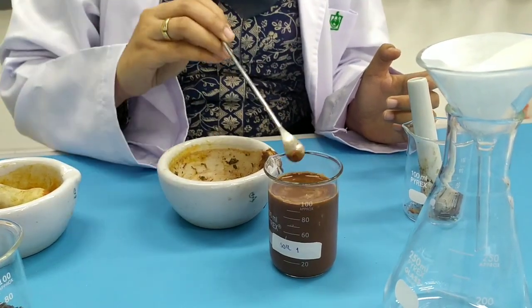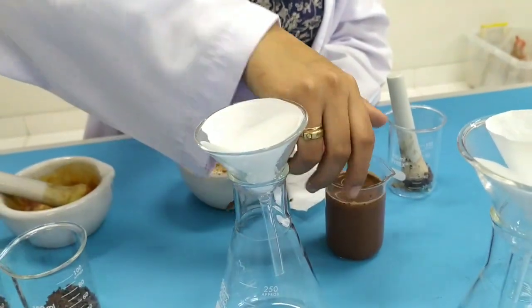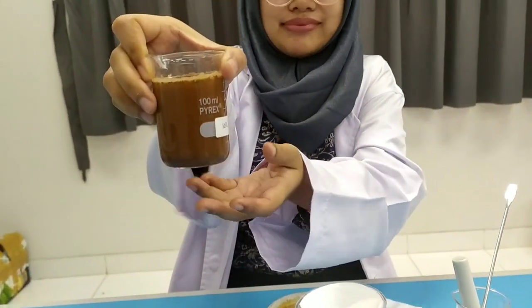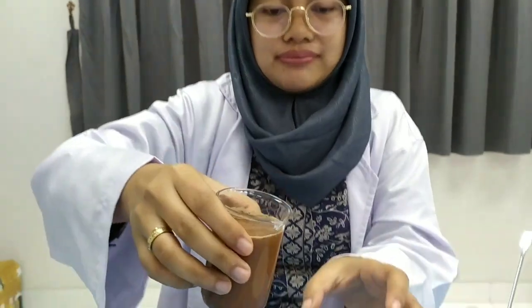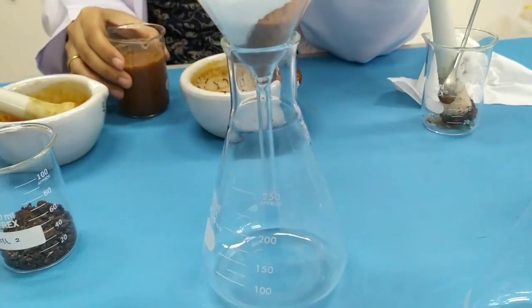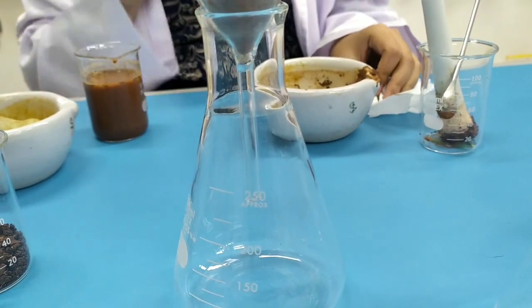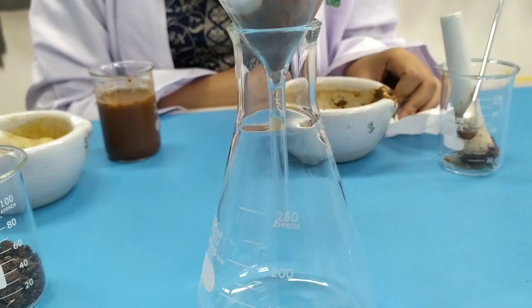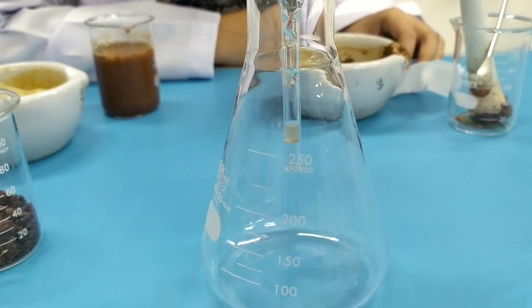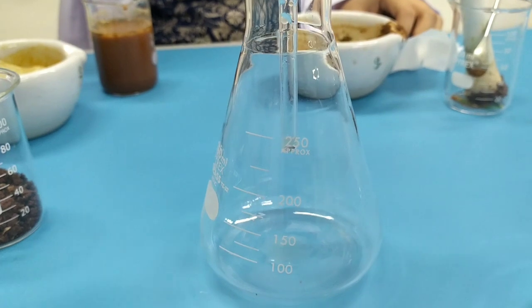Okay, this is the first soil. After we already mix the water and soil and it reaches 100 ml, we will pour the mixture into the funnel and let the filter paper work completely. As you can see, the water is slowly going down through the filter paper — one drop of water going down from the funnel. We have to wait until all the mixture is completely filtered.